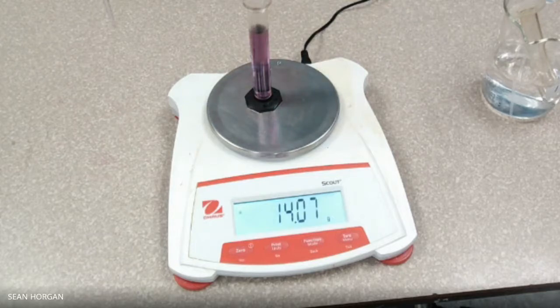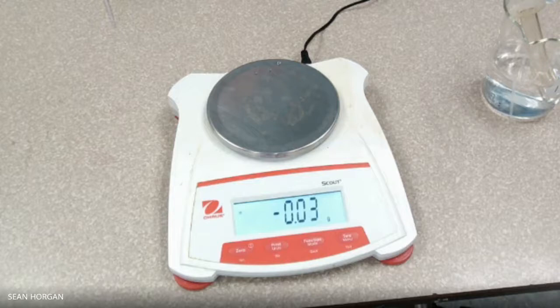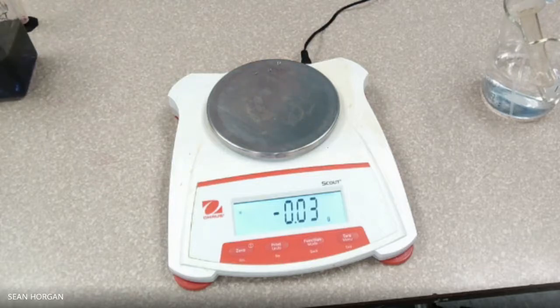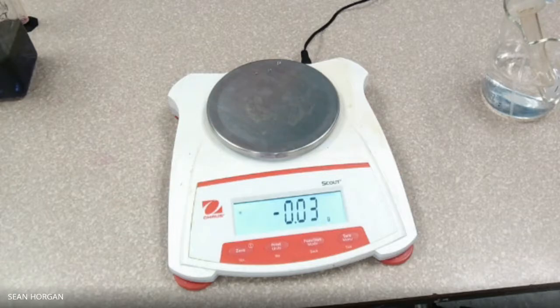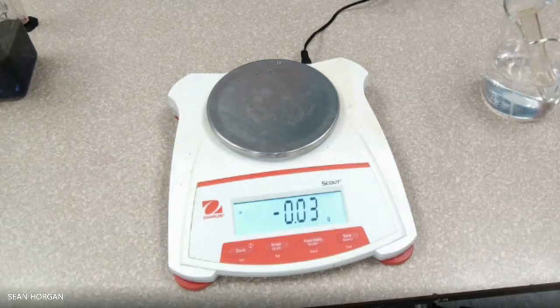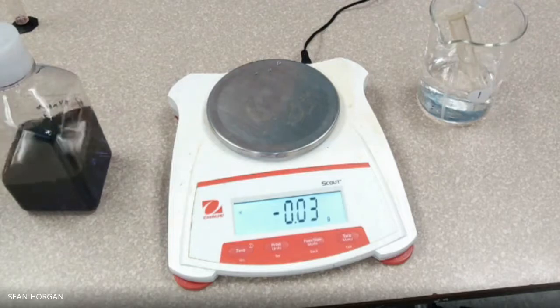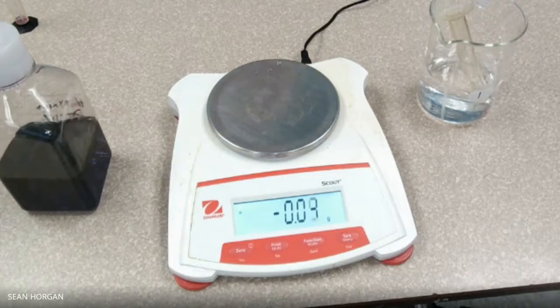Go ahead and calculate. What we can do right now is plot the mass versus the volume — two, four, six, eight, ten — versus the mass of just the liquid. So we can take the volume as the independent variable and what we measured as the dependent variable. We can figure out the mass of the water without the graduated cylinder, and the mass of the unknown without the graduated cylinder. From that — mass versus volume — we can put it into a graph to determine our slope, which tells us something we'll talk about later.